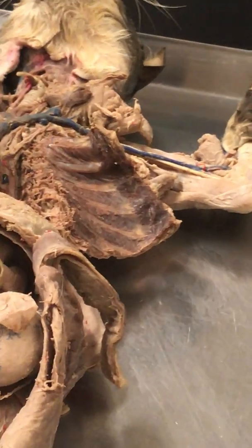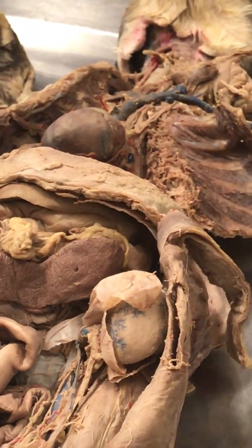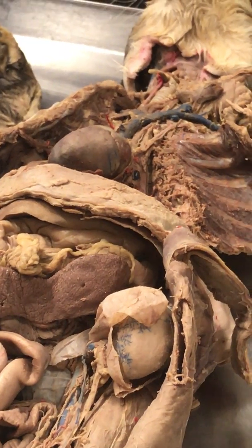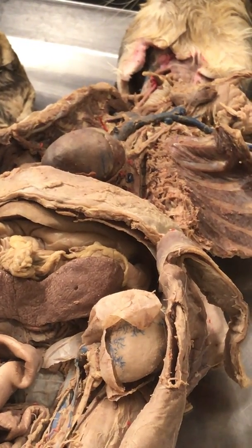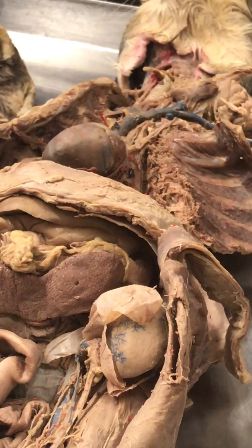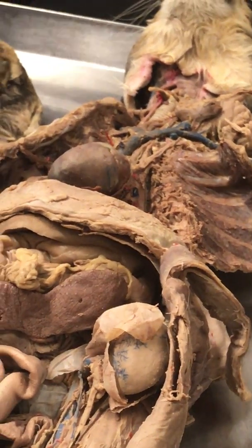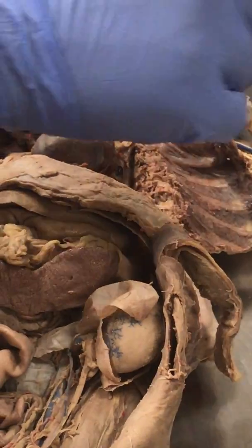On the exam, please put right or left artery or vein. Otherwise, I don't know if you know what you're talking about. Like left axillary, right axillary? Exactly, like left axillary or right axillary artery or vein. Okay? All right, so are you guys okay with this portion here?